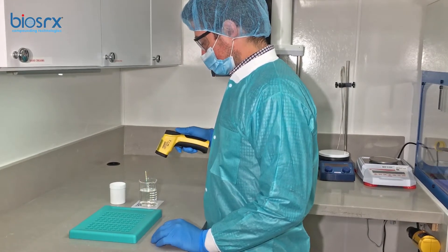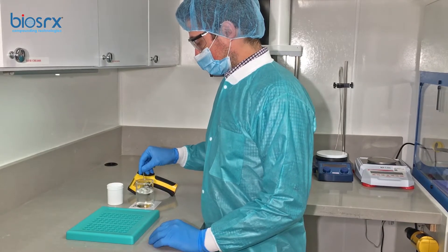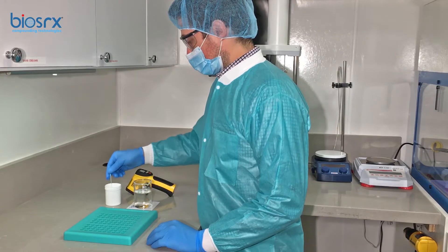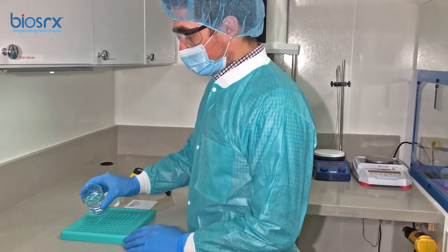The method we're going to use is just our pour and disperse. So Alex is going to pour the whole preparation, and in a tidy manner he's going to spread the contents amongst every cavity. We've got the temperature to 72 Celsius.